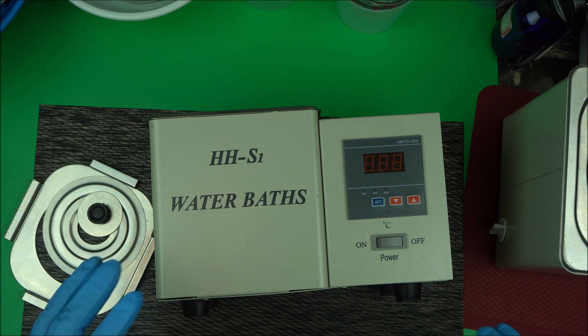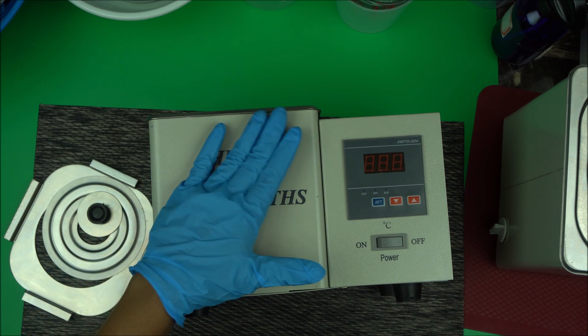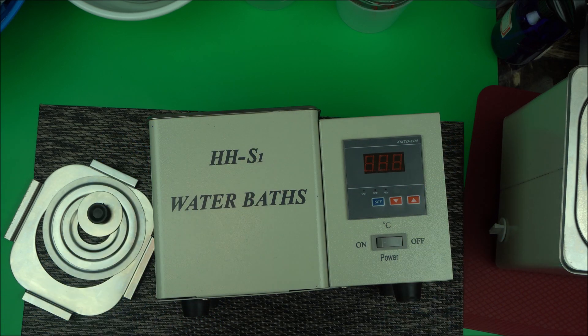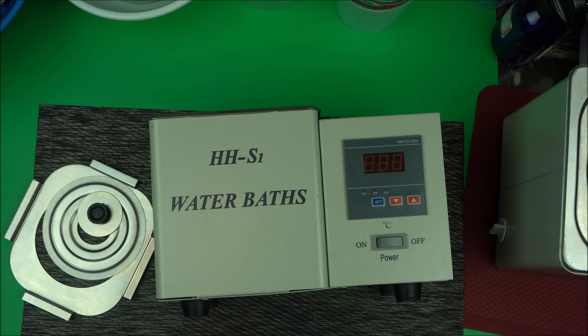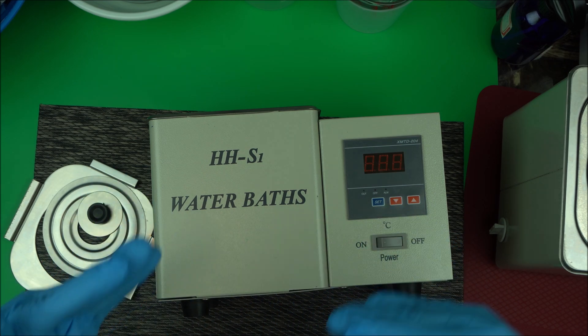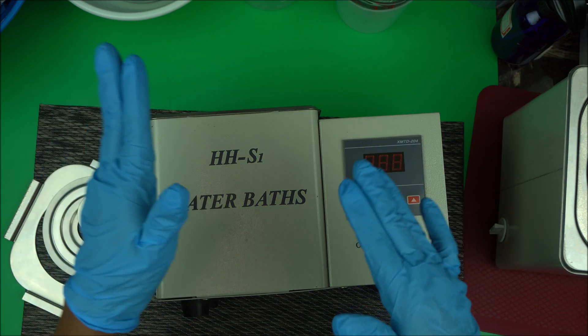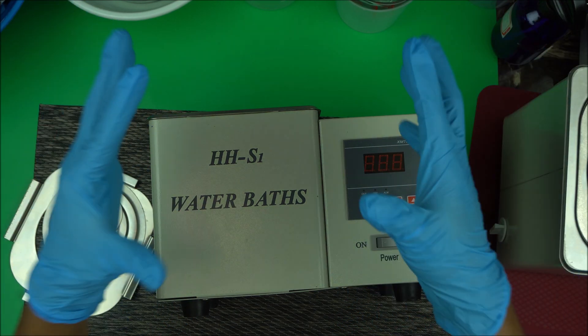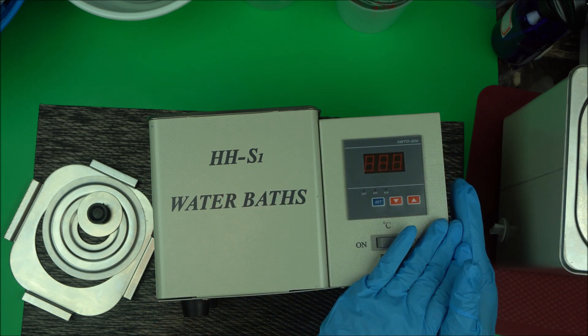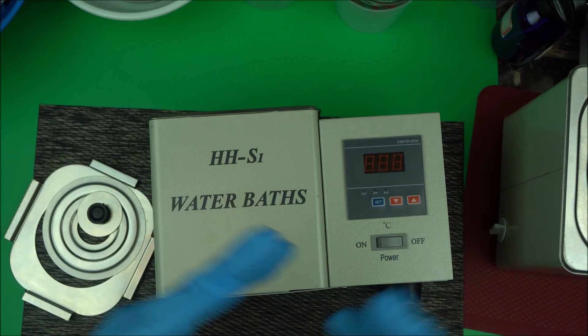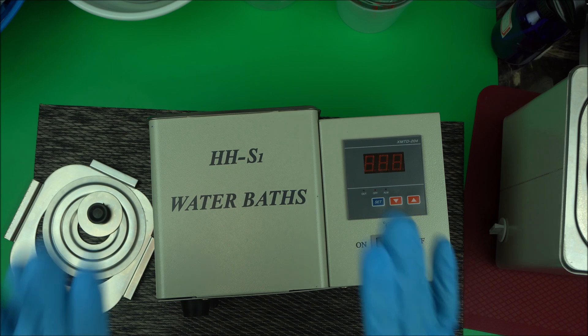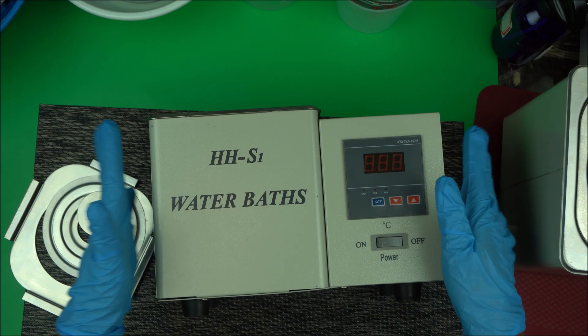The importance of a water bath is that you can control the temperature. It helps to melt your oils better and warm your water better in a more professional way. It prevents contamination. Instead of having to go to the stove with your makeshift double boiler, you can do everything on your formulation desk.